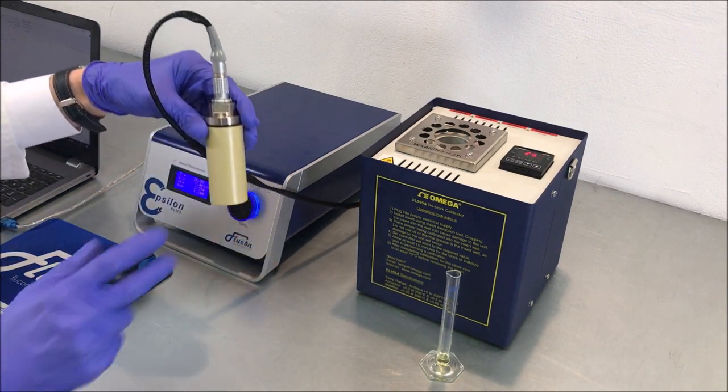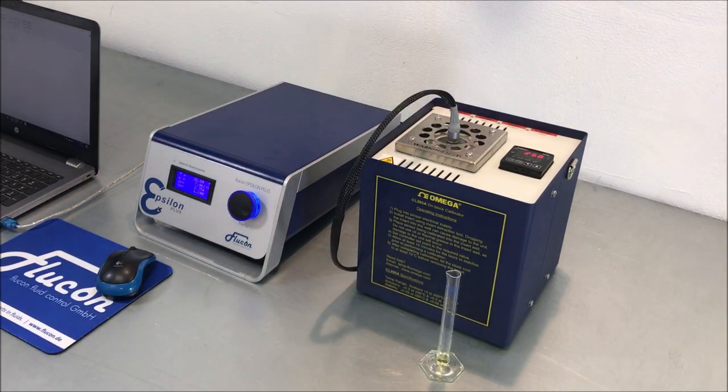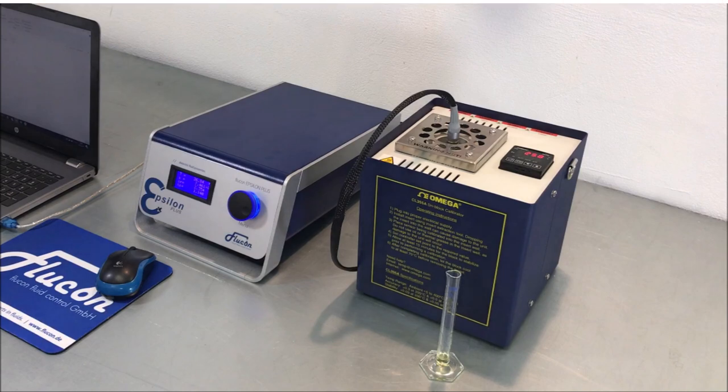You may now insert the sensor into the thermostat.